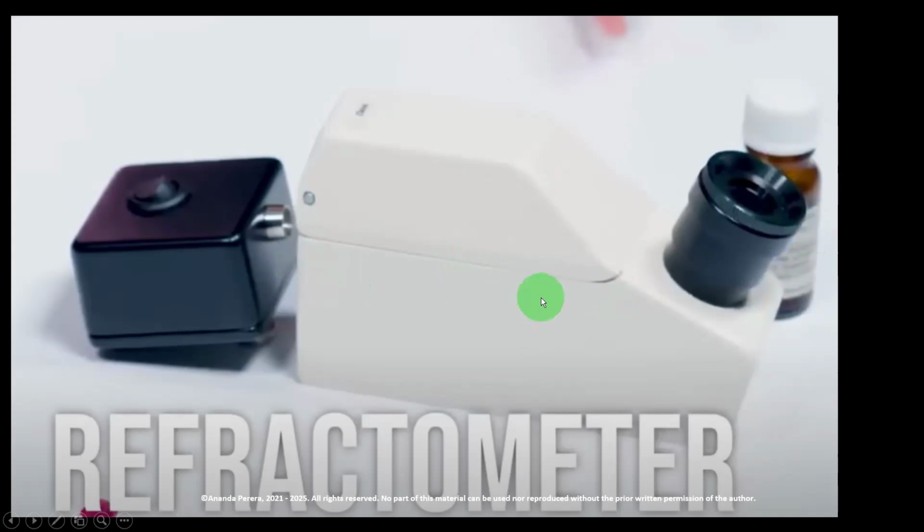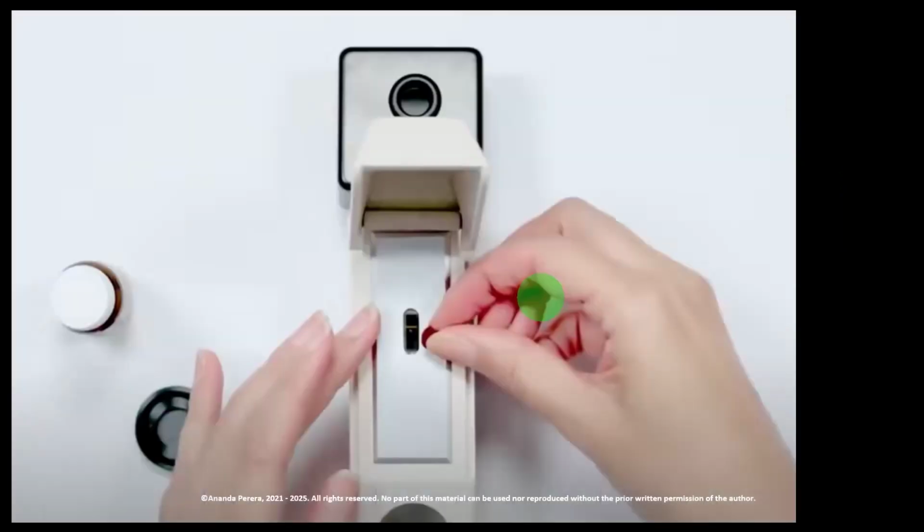Then we are moving to the inside of the tool. Look at that. When we open the hemicylinder, there is a glass here, and you need to put a single drop of methylene iodide on the top of this glass and put the stone. If it is a cut and polished stone, the polished facet has to touch the glass inside the hemicylinder, with the methylene iodide drop.